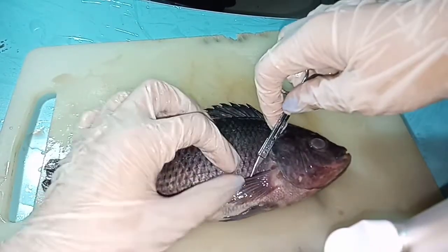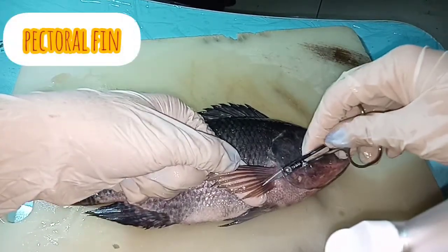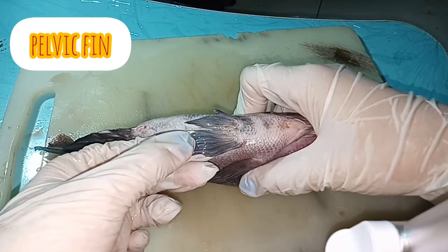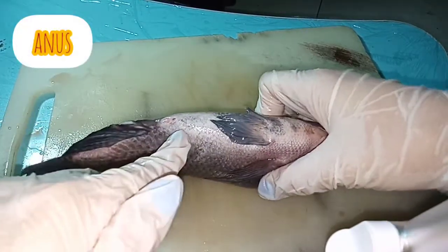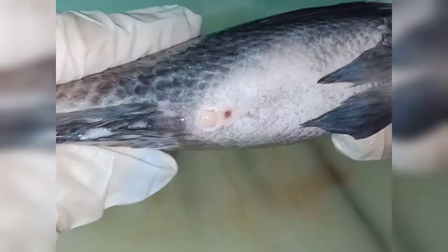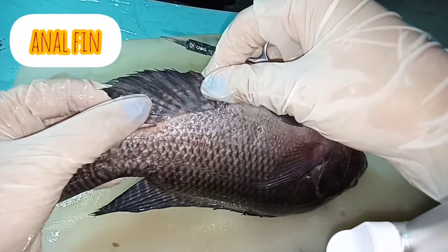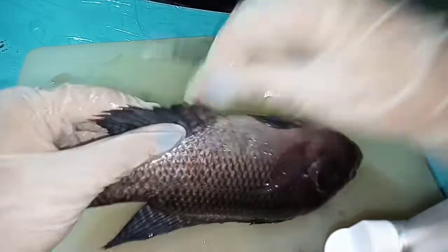This part is called the pectoral fins. And below the fish, we could see the pelvic fins. Near the pelvic, we could see the anus. This is the anus of the fish. Next is the anal fins — it is called the anal fins because it is located near the anus.